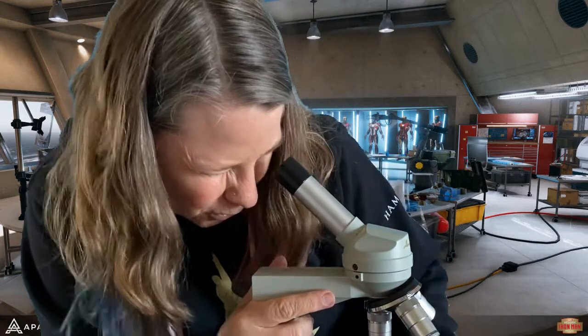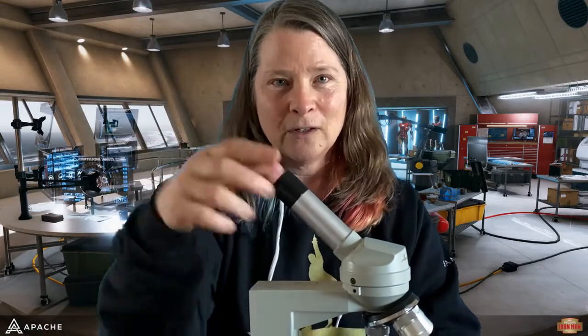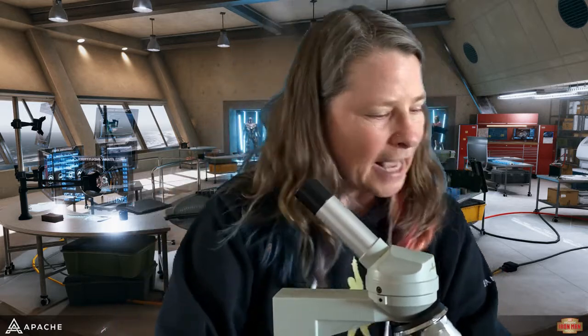I would show you how to do this, but I can't really show you with this one because if I look through here, you can't see what I'm looking at. So maybe we could try to do that, where you could hold the phone here and try to see, and I could talk about that. Okay, all right. And then the next part, H.